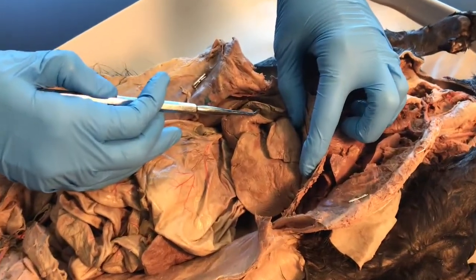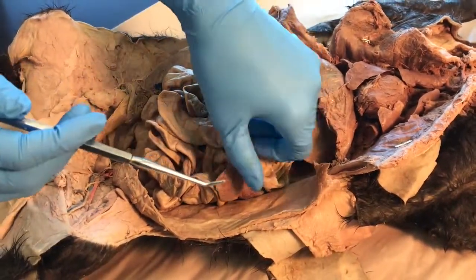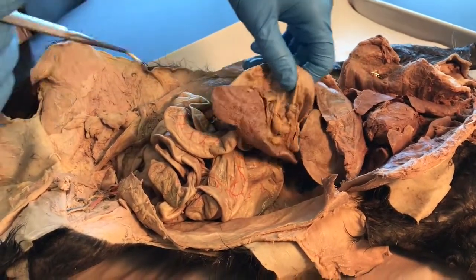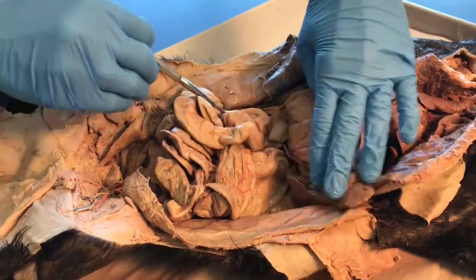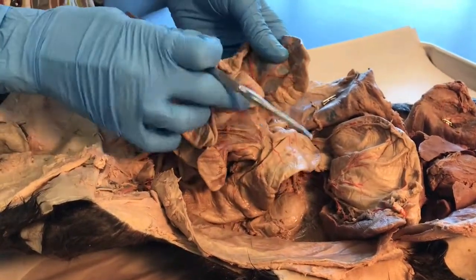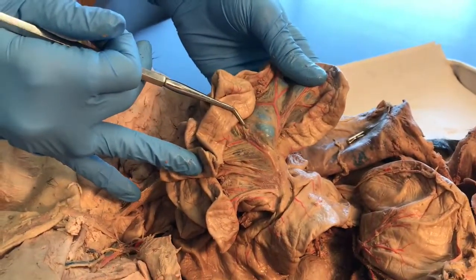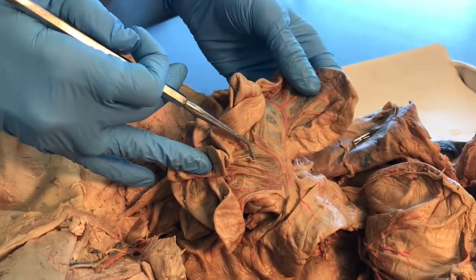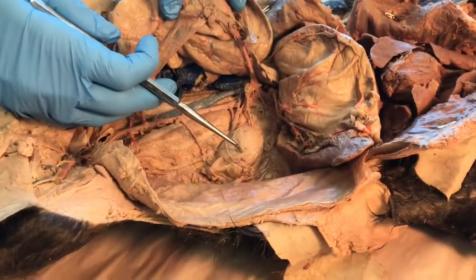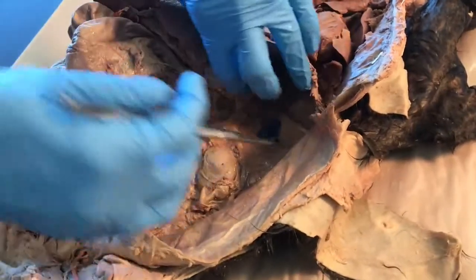There's the gallbladder. Here is the stomach, laid out just like a bag. On the left side of the stomach is the cat's large spleen. Underneath the stomach and the spleen are the intestines. The mesentery of the intestines is the membrane holding the intestines and bringing blood — this clear-looking membrane is the mesentery. Here is the left kidney.